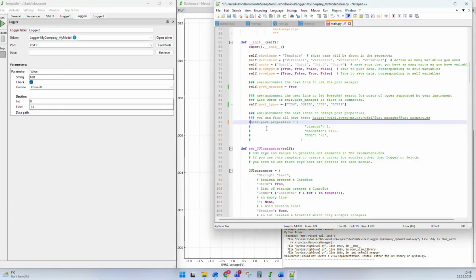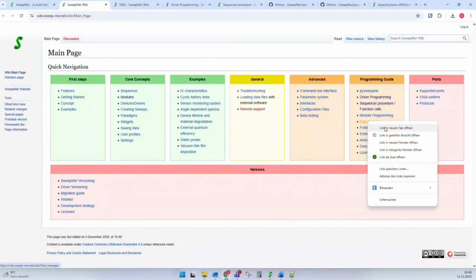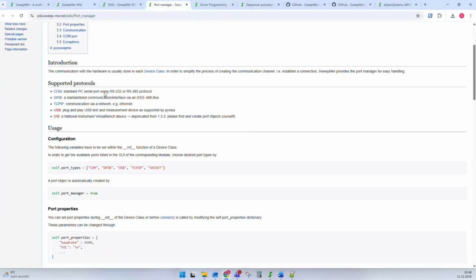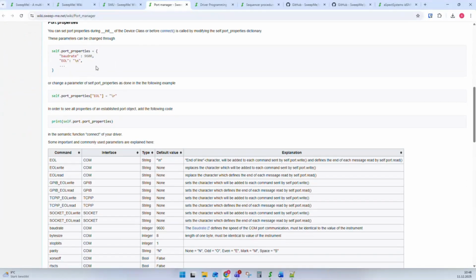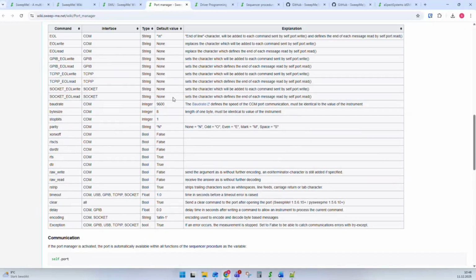Additionally, there is the self.portProperties dictionary. If you activate it, you can define a couple of options, like the timeout, the baud rate, and EOLs, also end-of-line characters, also terminator characters, that are applied to these ports that are opened. And again, in the wiki, we can go here to programming guide, port manager. Here the port manager is explained again with these port types, with port manager true, port properties, and you will find a list of all these properties that you can add to the port properties, and for which interface they apply and which type they should have and what is the default value and what their meaning is, and you can add them.